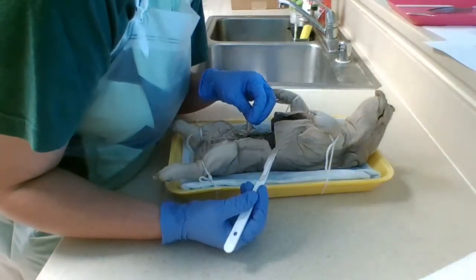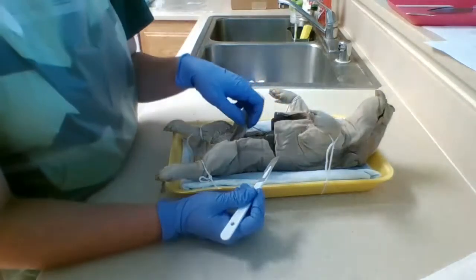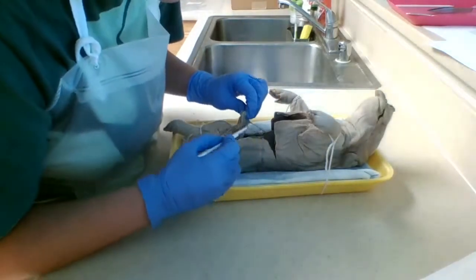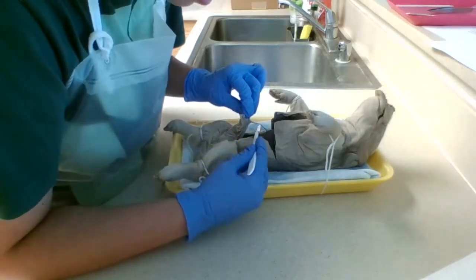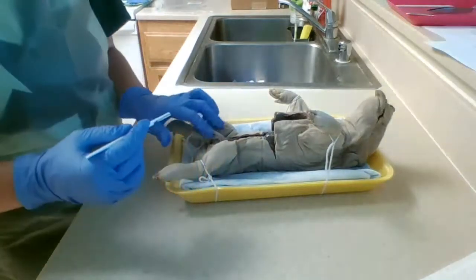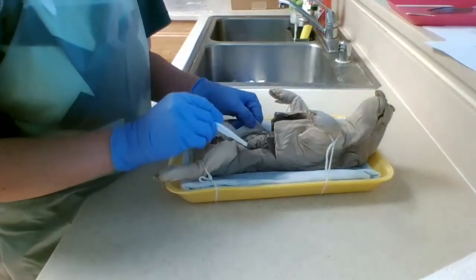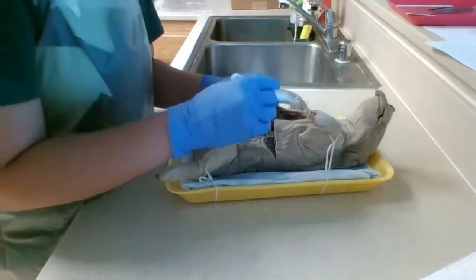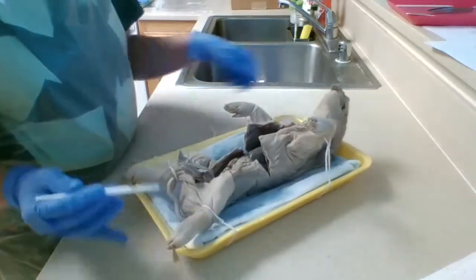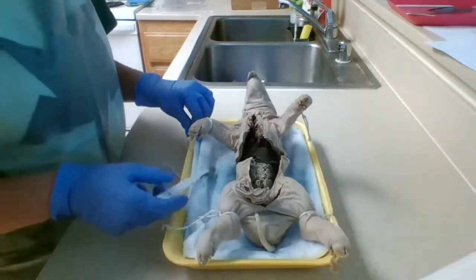The umbilical cord cannot be turned back until the umbilical vein running from the cord to the liver is cut. So the umbilical vein is this little guy right here, and now I'm going to cut it in half. Ta-da! Okay. Alright. Turn it towards the camera so you can see that I'm all open.